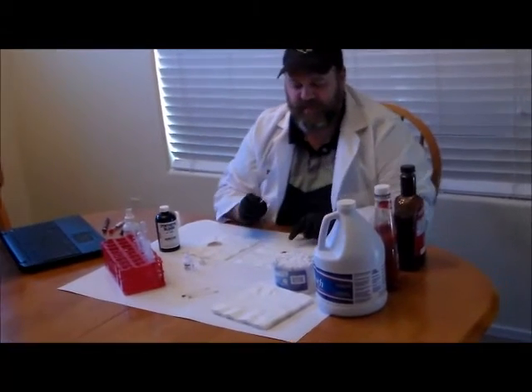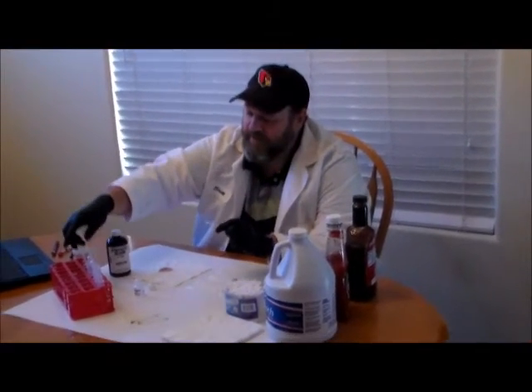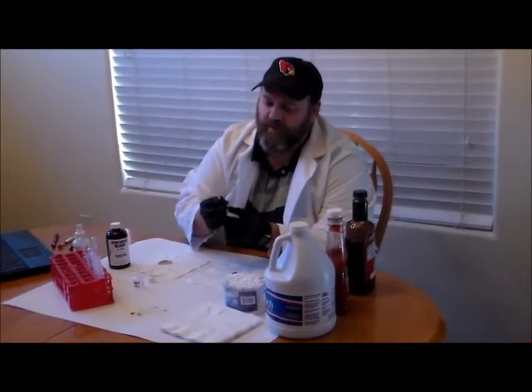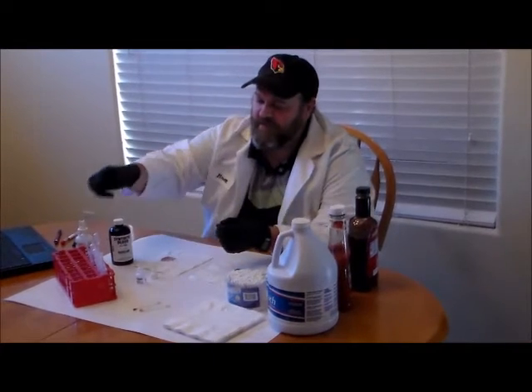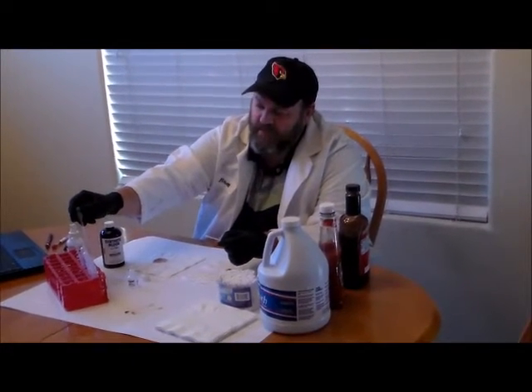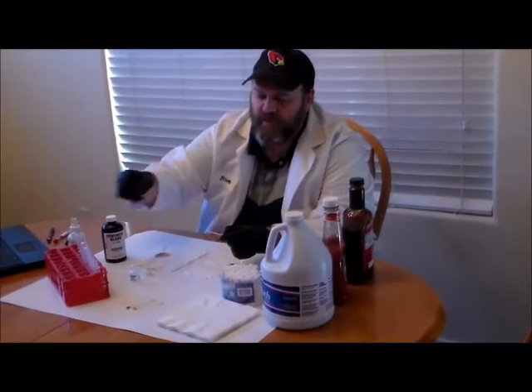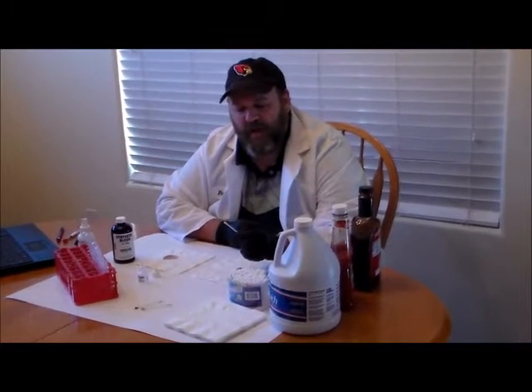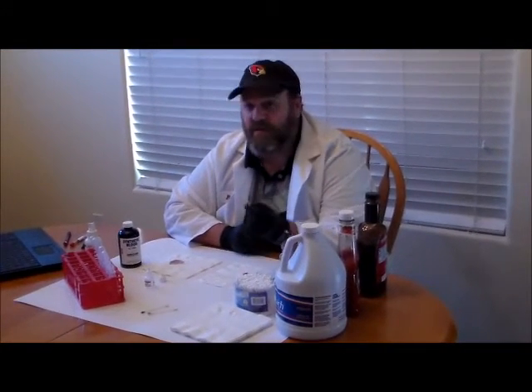What if I were to try and test ketchup? I have a ketchup stain here. I'm going to collect some of my ketchup stain on the end of my swab and test it using these same chemicals. I'm going to add a couple drops of water to moisten the swab, rub it against my ketchup stain, and then apply the leukomalachite test — it's only a one-step test. We're looking for a greenish-blue color. And we can see there's no reaction, so even though ketchup might look a little bit like blood, it doesn't react the same way. That would be a negative.